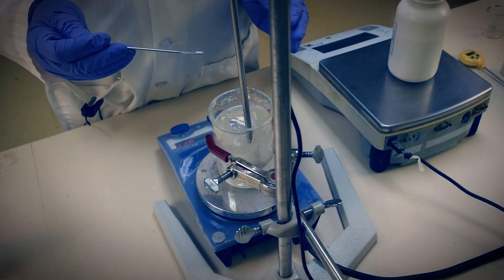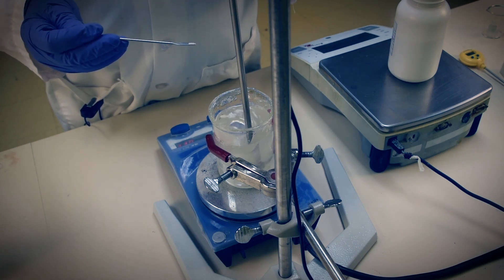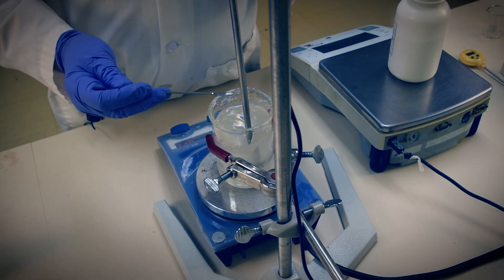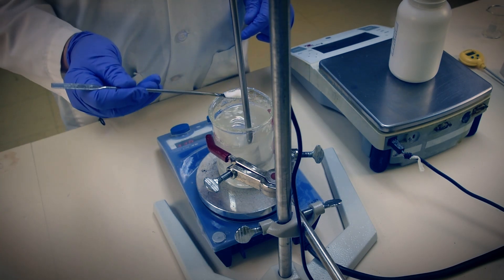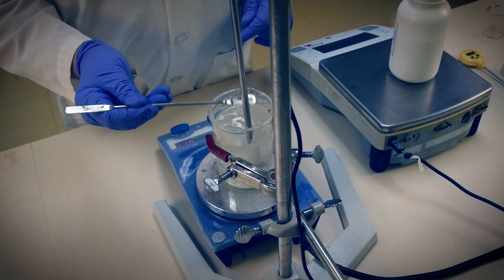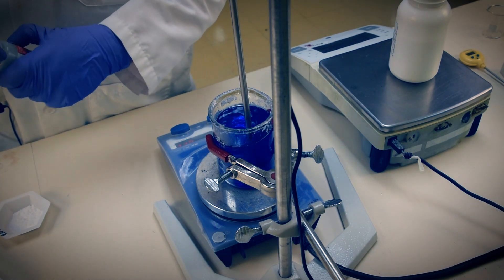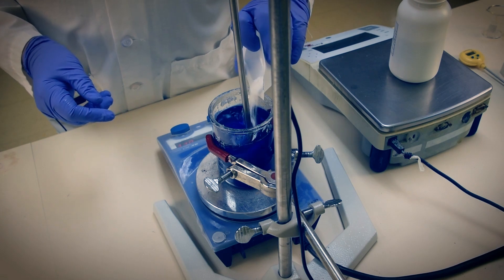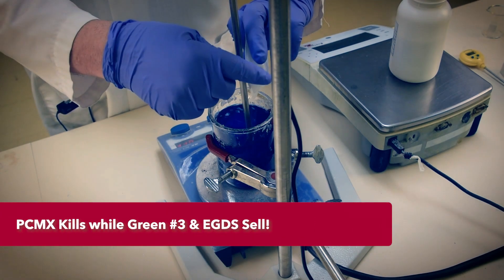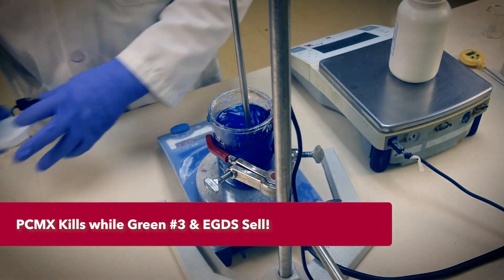We now have the stick base, but we have much more to add to suit our deodorant application. First, disodium EDTA, then parachlorometaxylenol (PCMX) to quench the stench from underarm bacteria. Then we'll add FD&C Green No. 3 and EGDS just to make it pretty. The glycol stearate will lend opalescence to an otherwise bland translucent stick, and Green No. 3 will appear as teal, evoking our green theme.